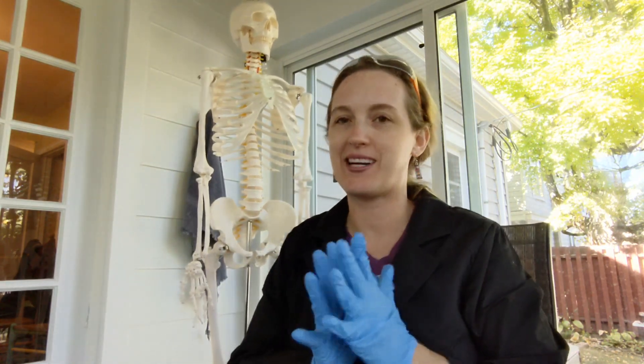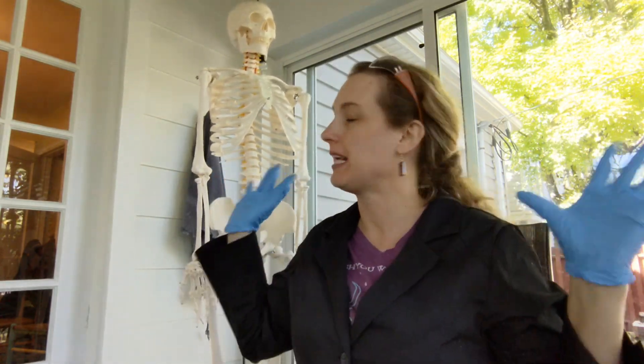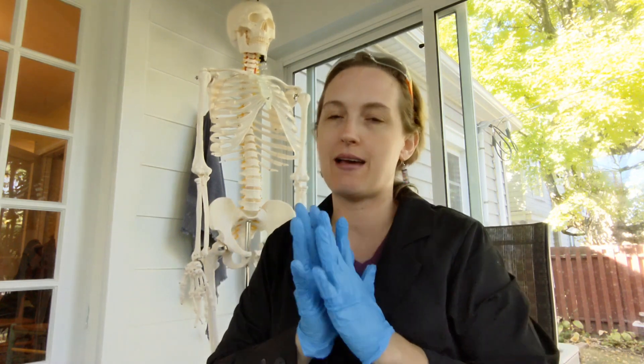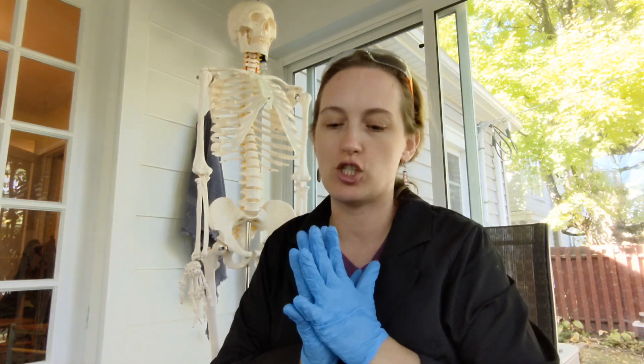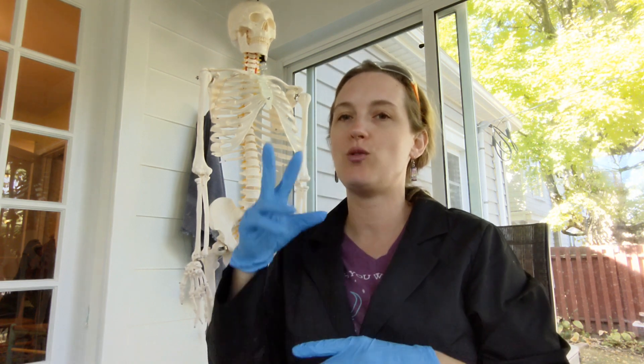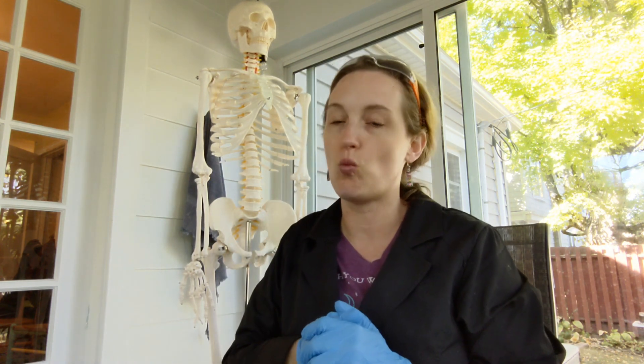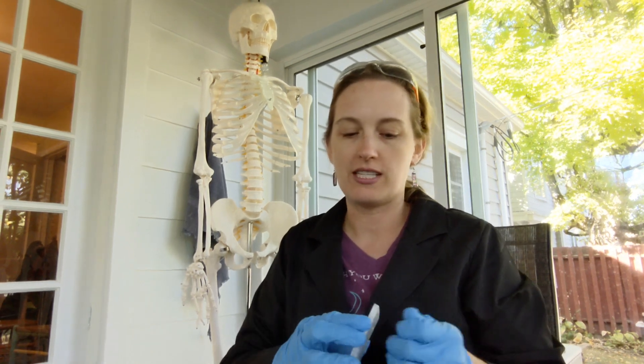Hi guys, I'm Heidi Hissrich and I'm here with my buddy Lucy. Today I'm going to show you how to load a gel with DNA for running gel electrophoresis, and I'll be showing you two methods: the dry load method and the wet load method. You can decide what you'd like, or maybe your teacher will give you some time to experiment with each of them.